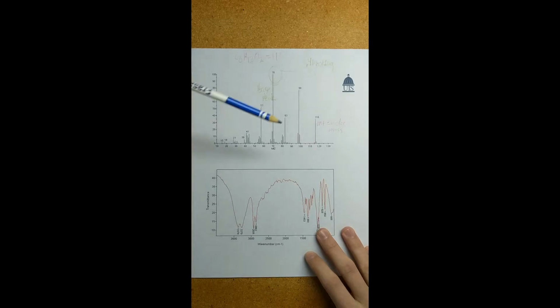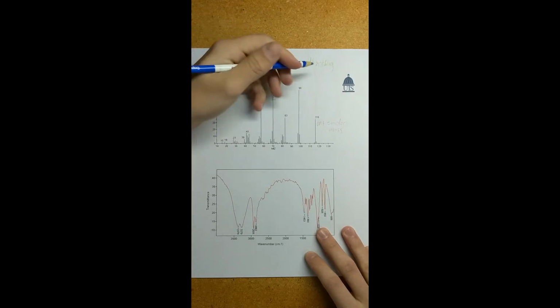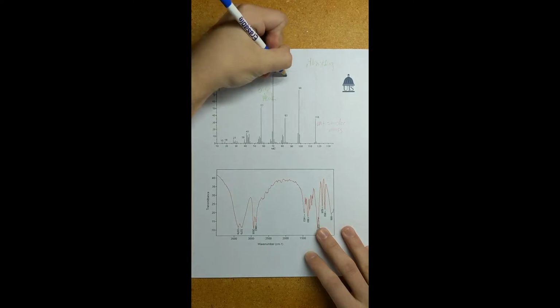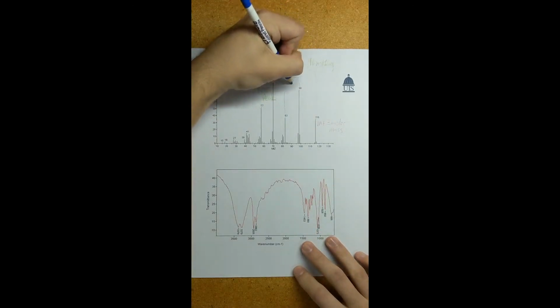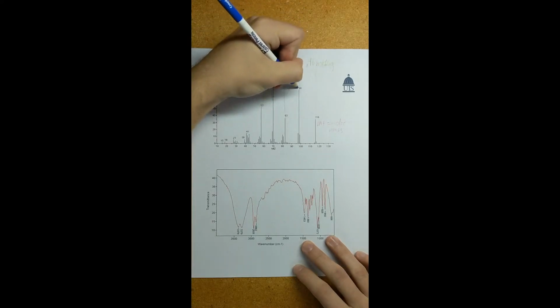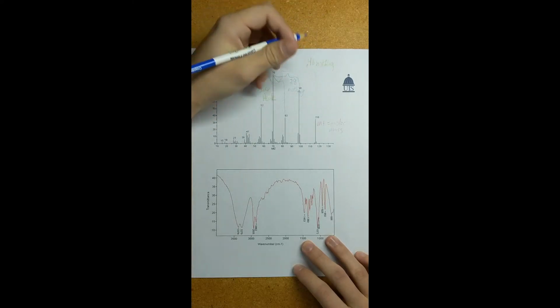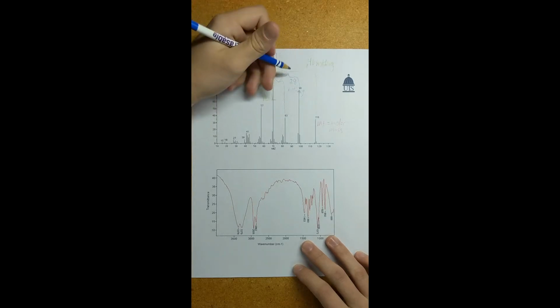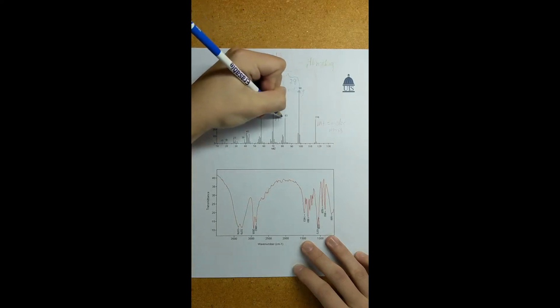That will not be important to me. And then also we have some pretty good size peaks in between our base peak and M plus peak, at 98 and 83. So we're going to label from our base peak to those as well to see if those differences represent anything. After doing the math, we'll see that this difference is 28, which Compound Chem says represents no structure. So I'll label it quickly as nothing, just so I don't get it mistaken with anything. Same thing here, the difference between 70 and 83 is 13. Again, this represents nothing as well.